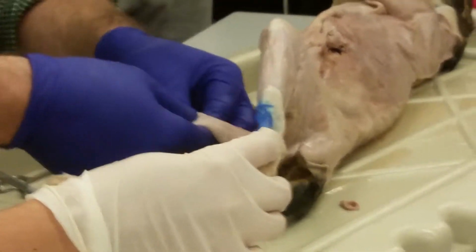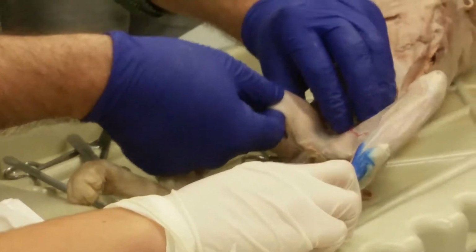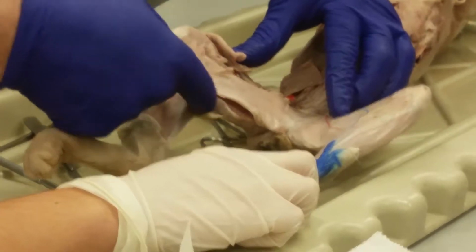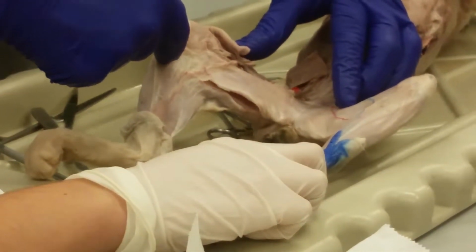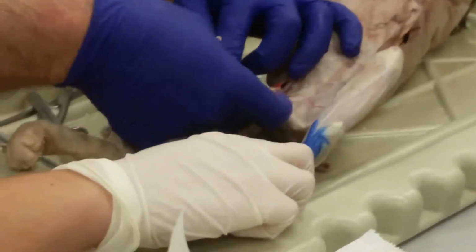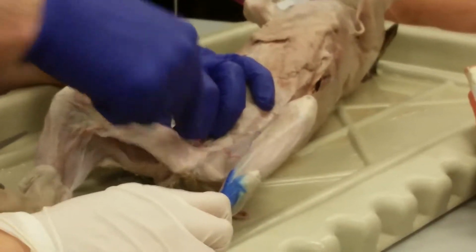Okay, so there's a flat muscle. It's coming from the pubic symphysis there, right in the middle, and it's coming along the medial aspects of the thigh and inserting into the tibia behind the knee. Can someone find that one that does that? It comes from right on the pubis on the medial side. Yes, right. Okay. So right from the pubis down behind the knee. Yep, you got it. That's the gracilis. Okay. Gracilis muscle. Right? So it's pulling from pubis, going from the pubic bone to the tibia.